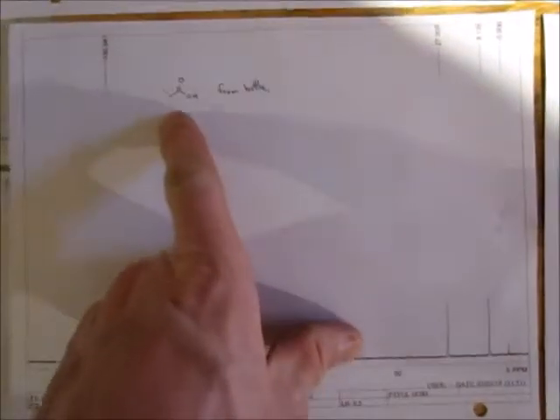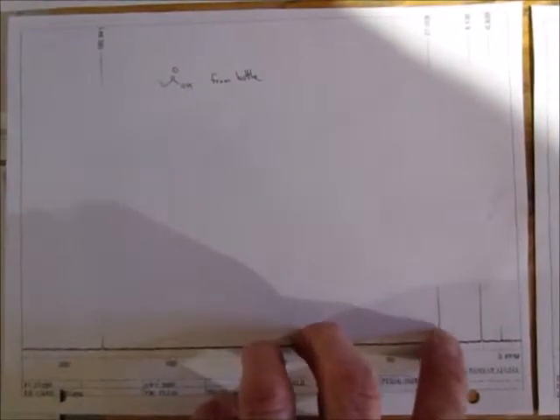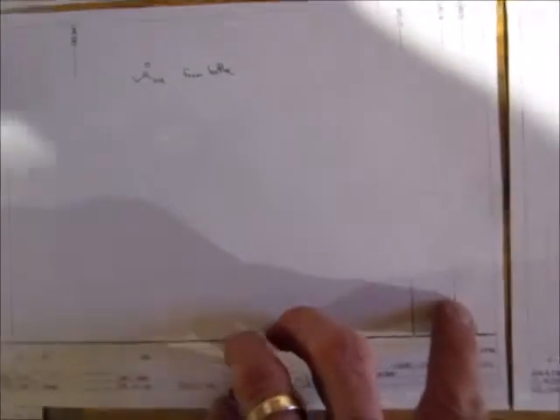Go on to carbon. We had an old carbon right there, and you can see it. You're going to see the characteristic 3 carbon peaks. You should make sense of that. The newer compound is also going to have 3 carbon peaks. You got the ethyl fragment, and you got the carbonyl that's way out here. That's the CH2 group, that's the CH3 group.